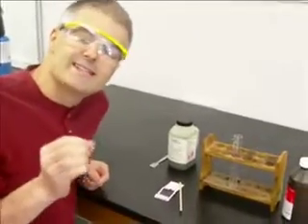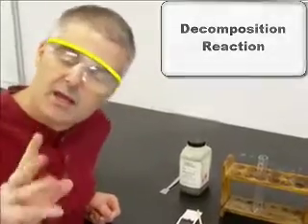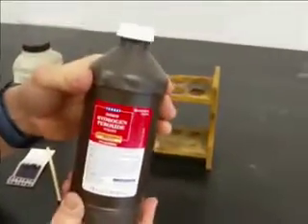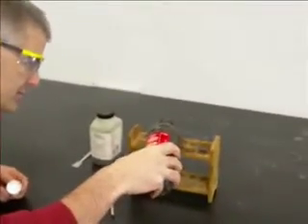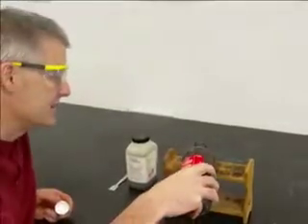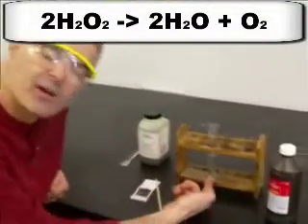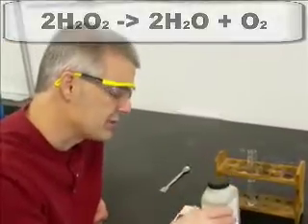All right, I want to show you today a decomposition reaction. Now remember, in a decomposition reaction, you start with one thing, it breaks apart into multiple things. So the chemical I brought with me today is hydrogen peroxide, okay? This is the stuff that you can just buy at City Market or King Soopers or whatever your local grocery store is. I'm going to pour that into a test tube. Now hydrogen peroxide by itself decomposes into water and oxygen gas. So it's actually decomposing right now, but it's a very, very slow reaction. So I'm going to add something to it that should speed up the reaction.